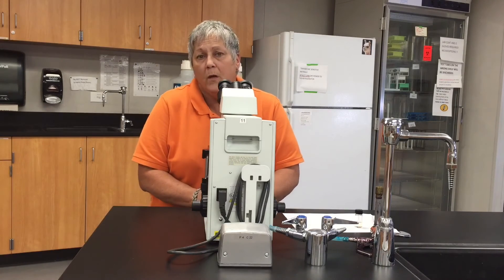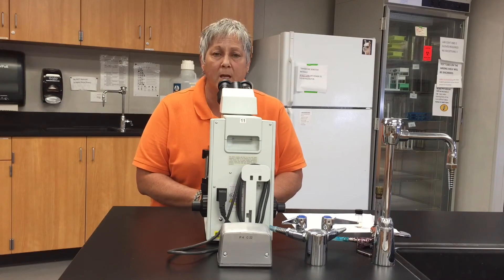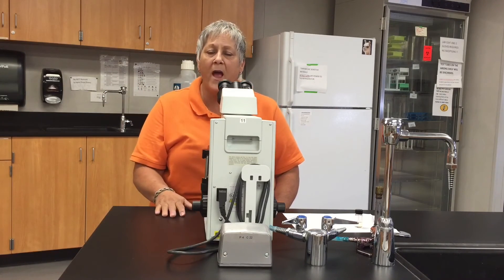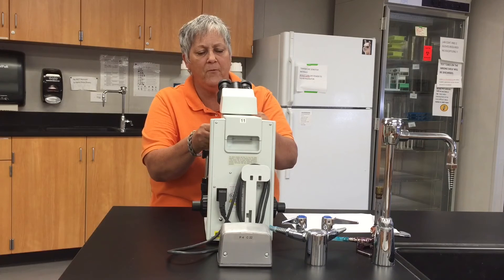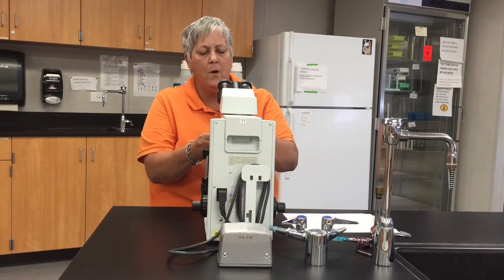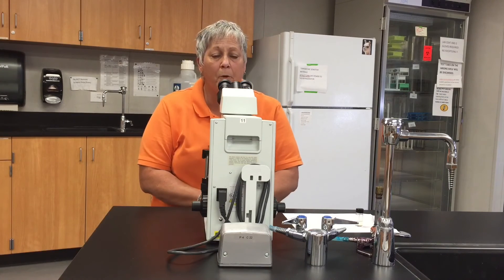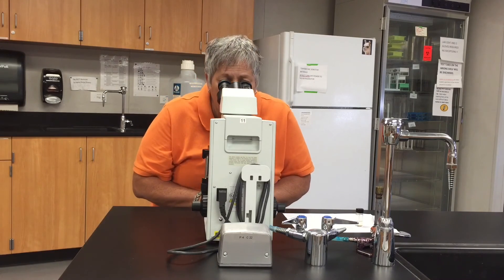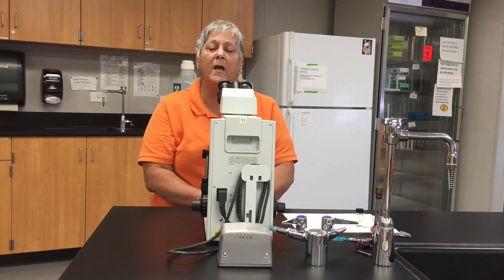This may be as far as you need to go — if so, make your drawings and observations. But if we need to go to the oil immersion lens, here's what to do: without touching the focus mechanism, swivel the lenses so you're halfway between high dry and oil. Get your immersion oil and put a drop right on the slide in the center circle of light, then swivel the oil immersion lens into place. It looks like I need more light, so I increase the light a bit, then play with the fine focus until the specimen is nice and sharp and clear.